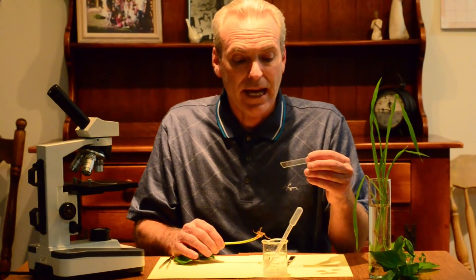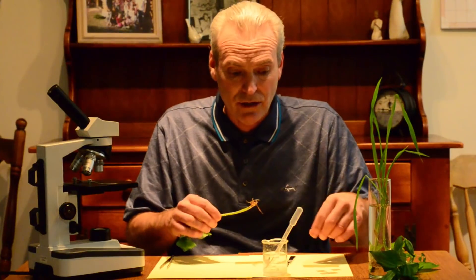And I've taught you how to make a wet mount slide. Remember, we're going to use water and put a drop of water on there and a cover slip in our specimen. Alright, come on in and we'll take a look at that.